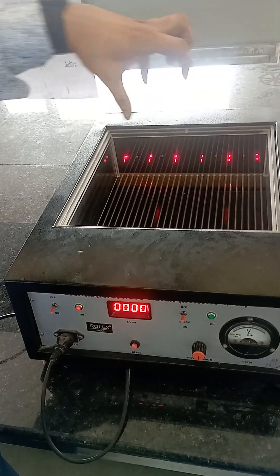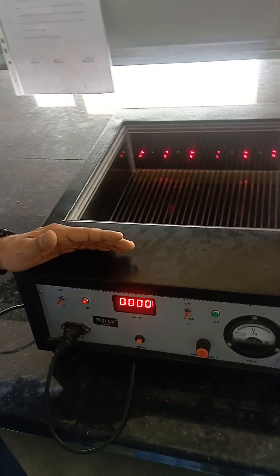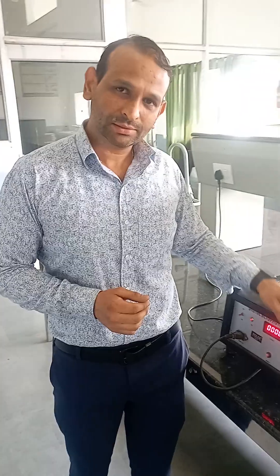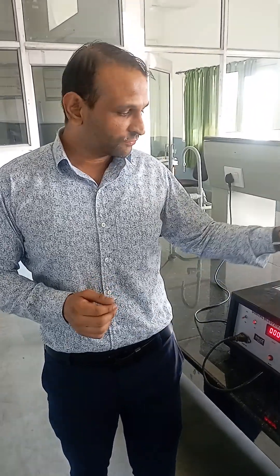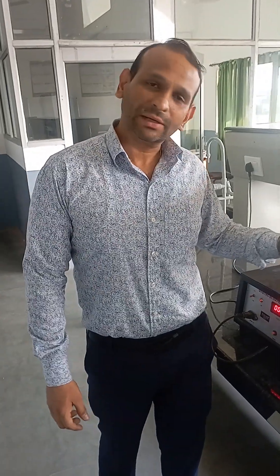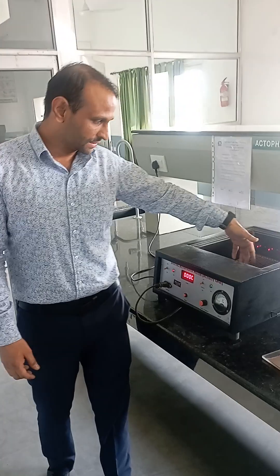First, we divide the animals into two groups, weigh them, and number them one by one. One group will serve as the control and another as the test group. We then place the animals one by one into the cages on the grid floor, as you can see.